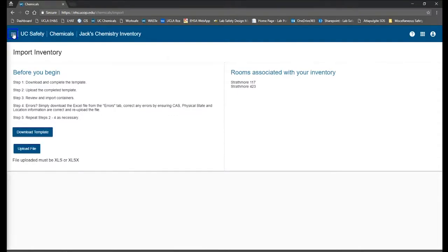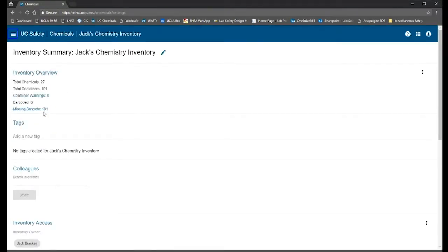And if you remember before, I only had 24 total chemicals. That has now increased to 27. I'd say the import's a success.